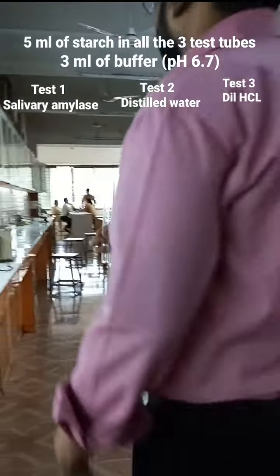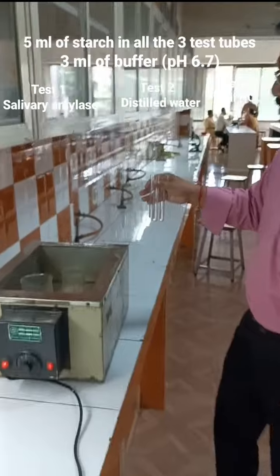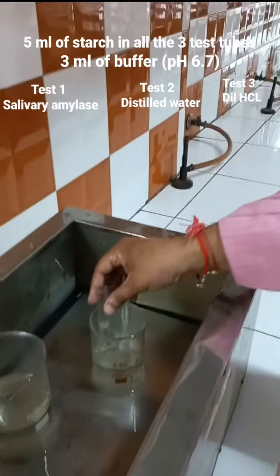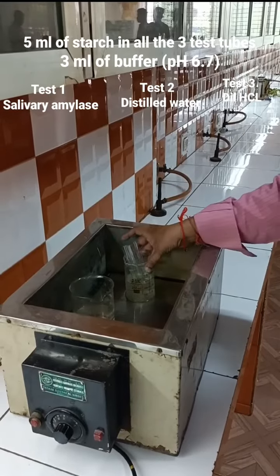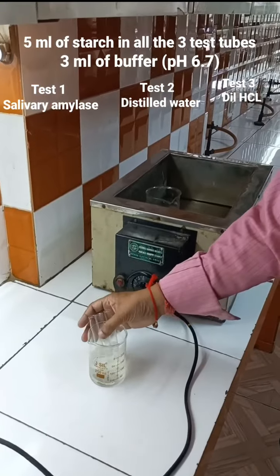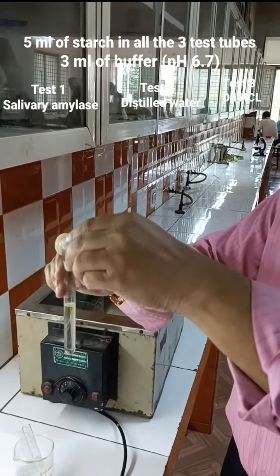Now keep all the 3 test tubes in a water bath for around 15 minutes at 37 degrees. 37 degrees is the optimum temperature for enzymatic activity. So keep it in the water bath for around 15 minutes. Now to each test tube you add 2 drops of iodine. So in test tube number 1, I am adding 2 drops of iodine.